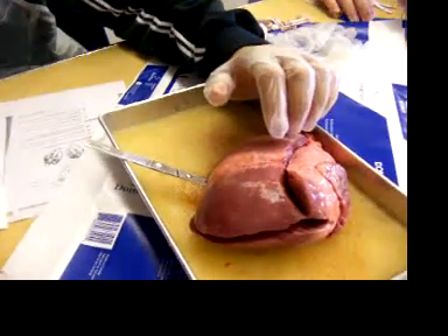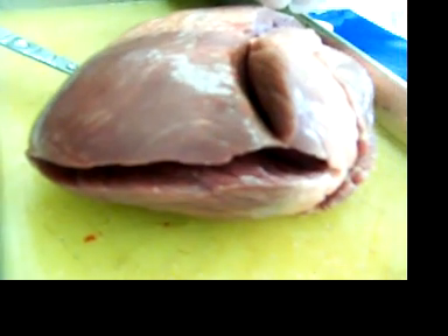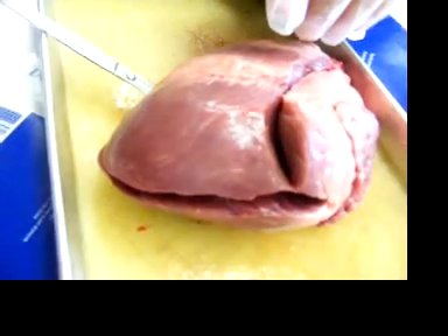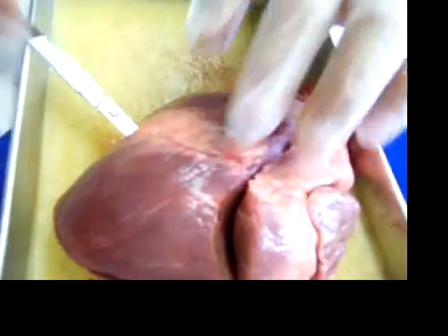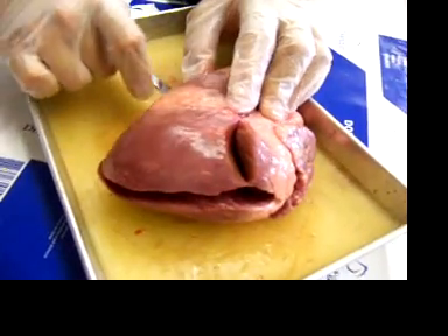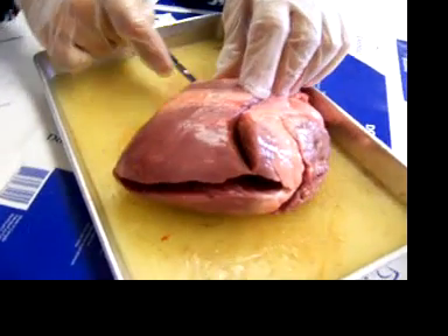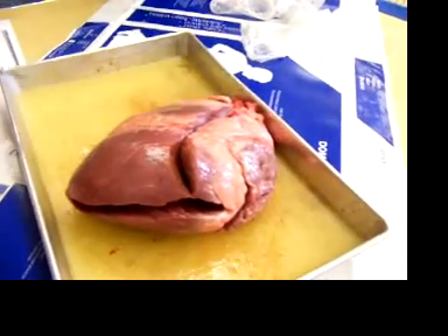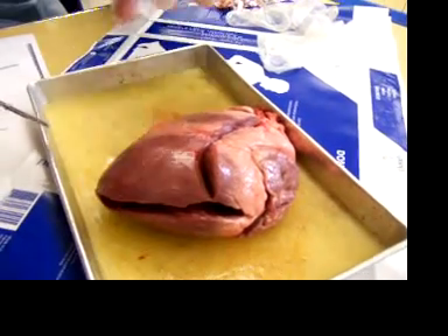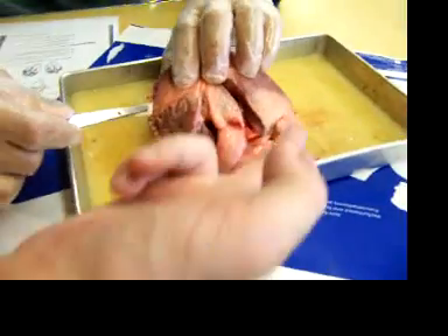Place the heart on it. Cut through the heart. It's tough. Where's figure 35.9? I don't have that. Right there. I'm just gonna kind of cut this in half, all the way through. Is that right? Well, it's a little low. See, it's gonna come up through like there — kind of that idea.